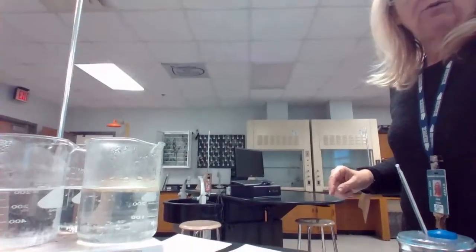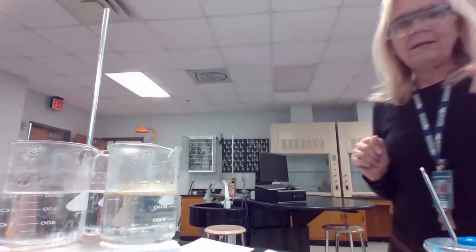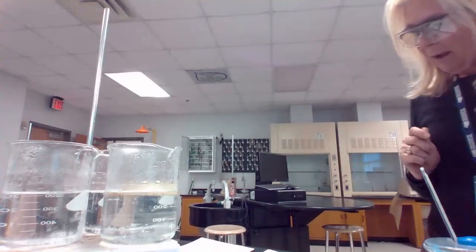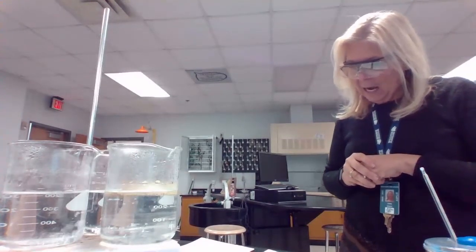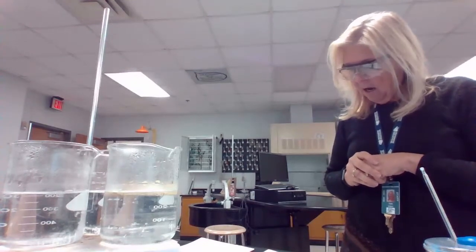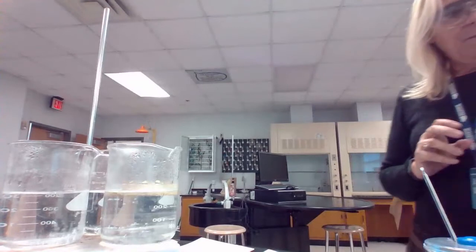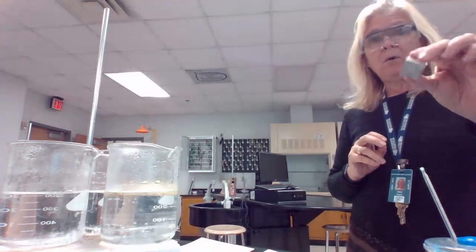We are, as you know, using the beakers where I have somewhere around 200 milliliters of water added in there, and I'm just waiting for the water right now to start boiling. And so while I'm waiting for the water to start boiling, I have gone ahead and taken the masses of my blocks so that we are able to calculate some moles later on.